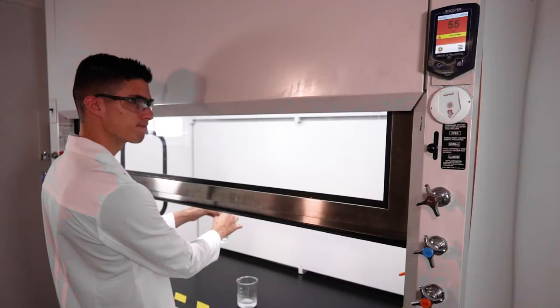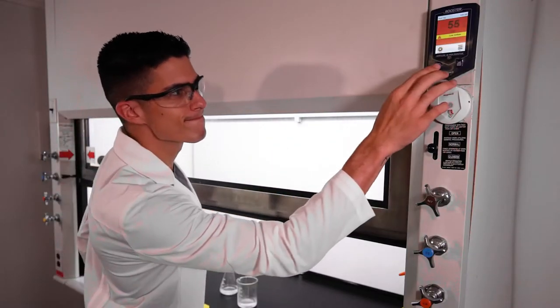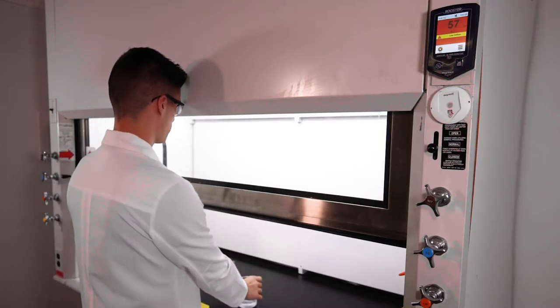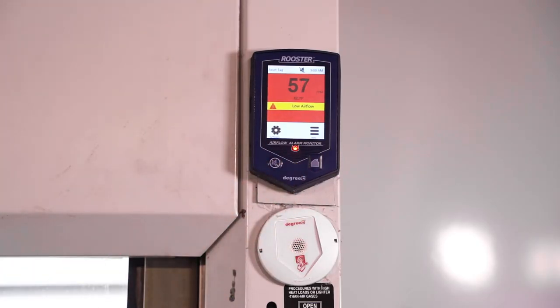If the hood alarm is sounding, don't just ignore it by muting it. This could mean your hood isn't performing correctly. Always tell your lab manager or maintenance personnel.